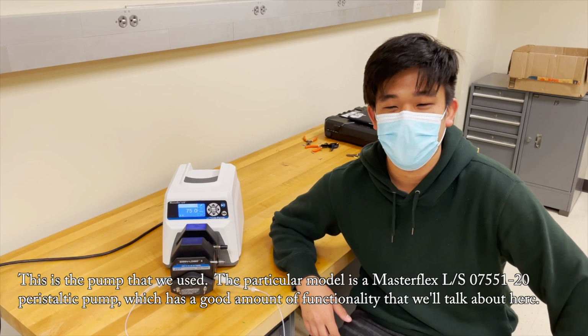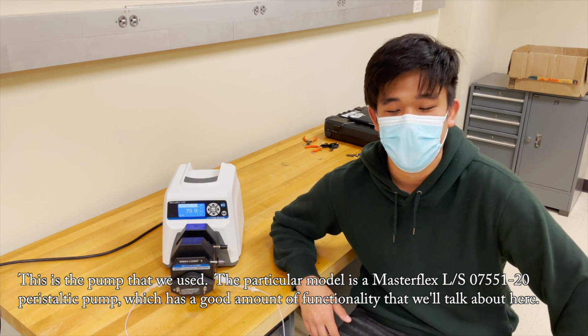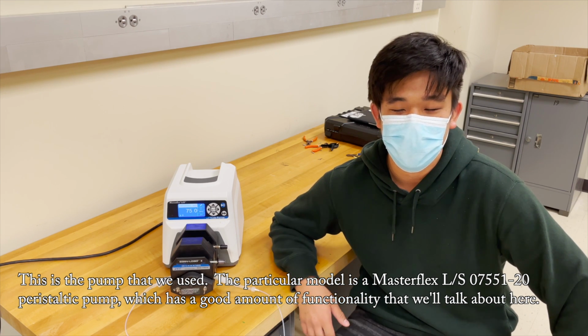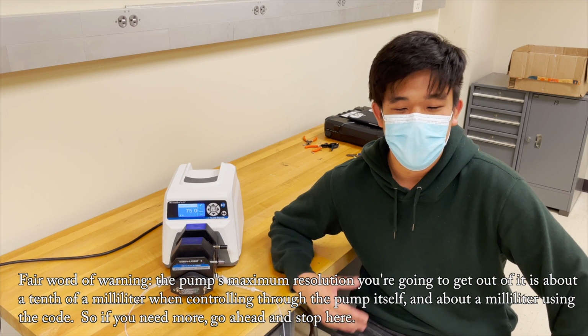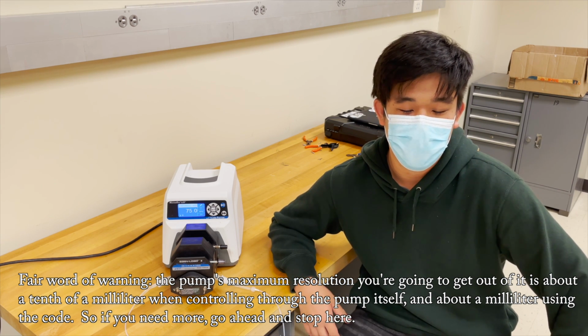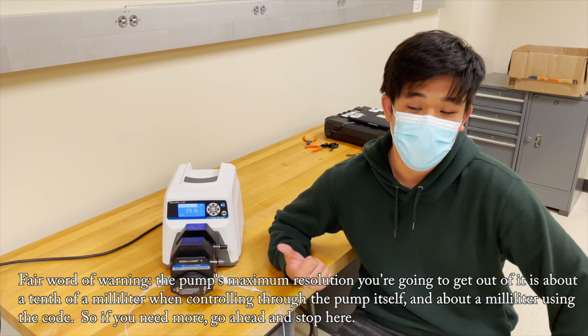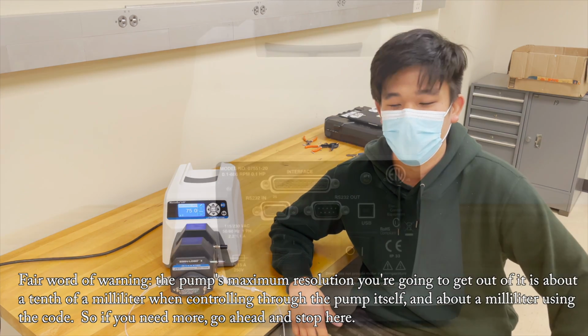This is the pump that we used. The particular model is a Masterflex LS07551-20 peristaltic pump, which has a good amount of functionality that we'll talk about here. Fair word of warning, the pump's maximum resolution you're going to get out of it is about 1/10 of a milliliter when controlling through the pump itself, and about a milliliter using the code. So if you need more, go ahead and stop here.